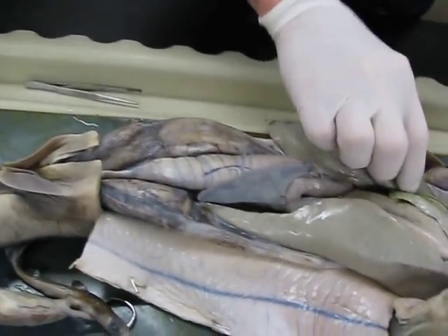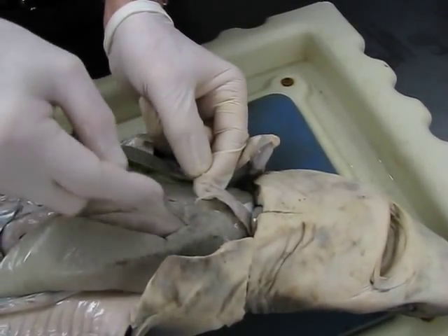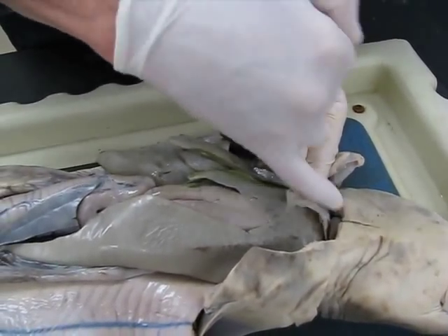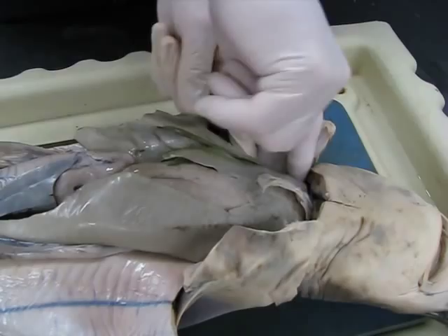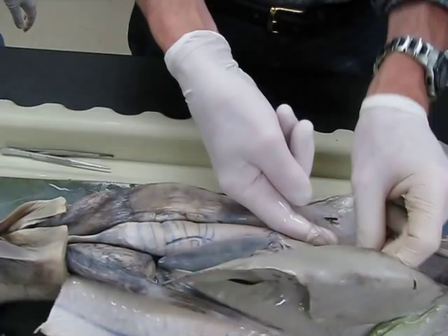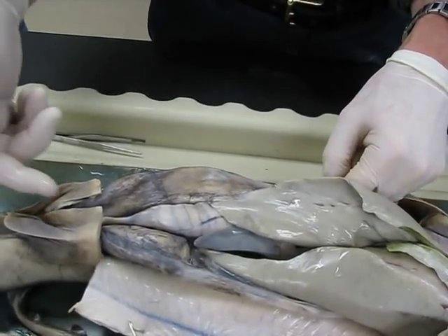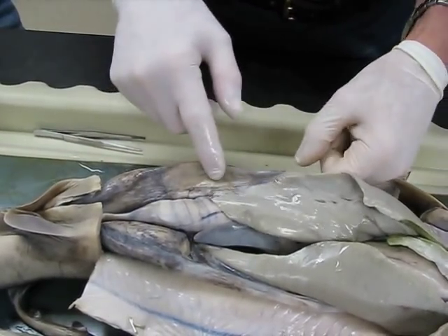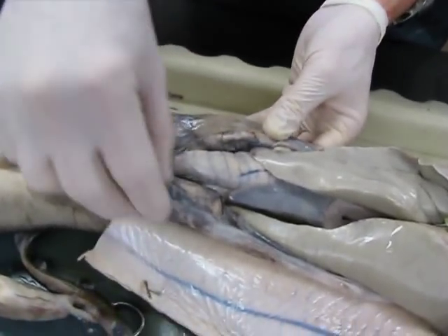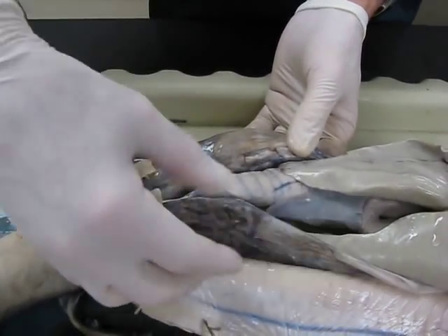They have to get down here to the oviduct, and this is going to be the uterus. How they do that is they bounce around until they come up here to the ostium tubae. The ostium tubae is the opening through which they move. They go in and then curve around and ultimately make this journey down the oviduct. Meanwhile, a male shark copulates with a female, inseminated sperm migrate up and fertilize those eggs. And here is the uterus, so the eggs begin development.